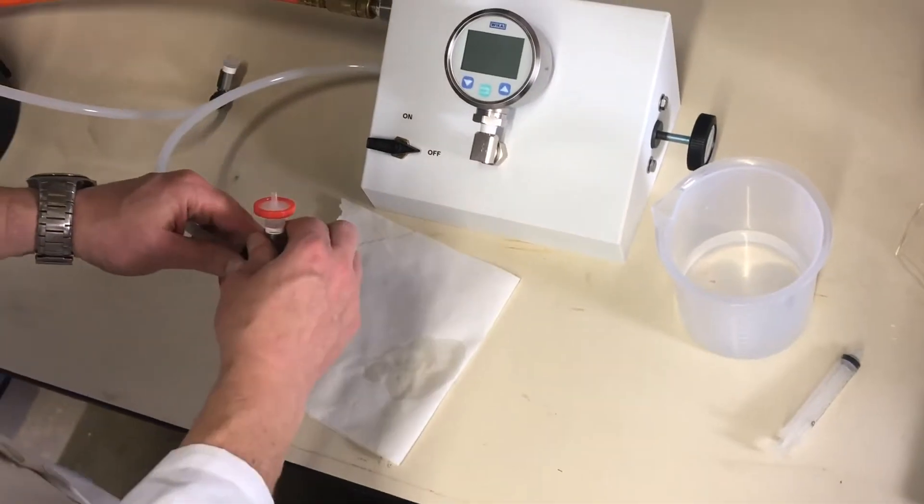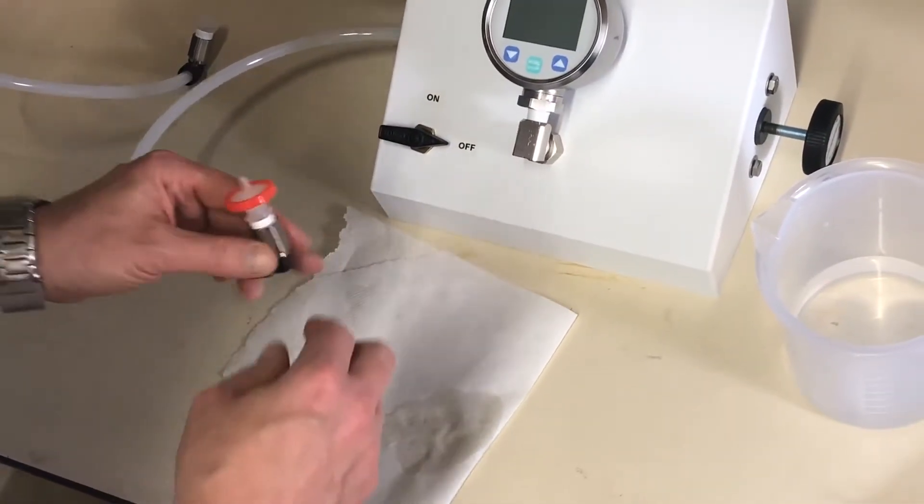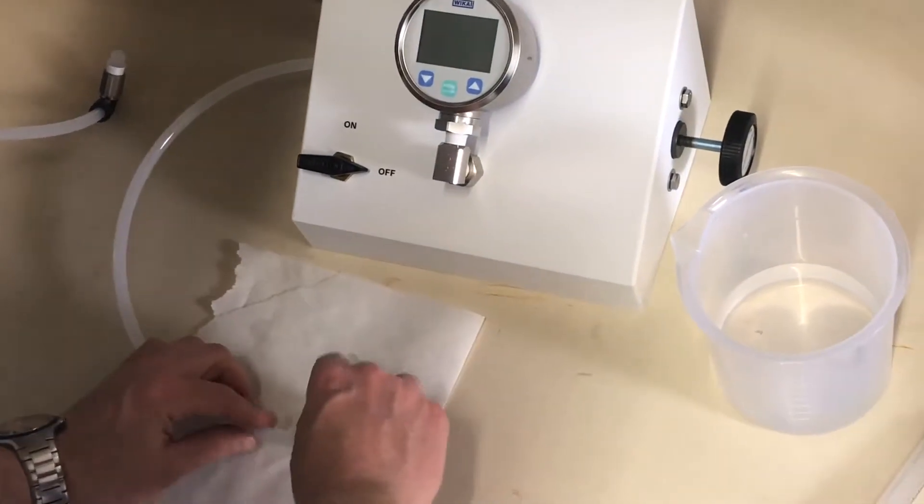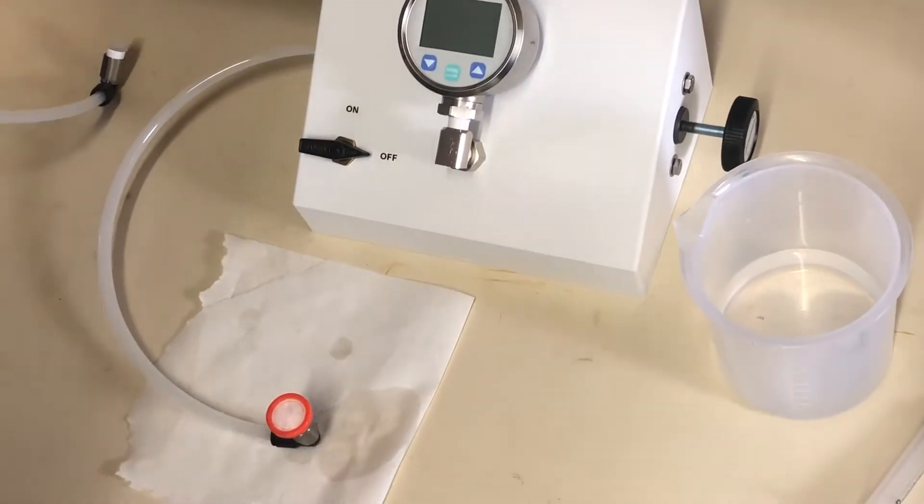And these fittings are swivels. So you do have to hold the fitting while you attach the filter, just to get a firm attachment. And once it's ready and attached, make sure that the outlet is pointing up.